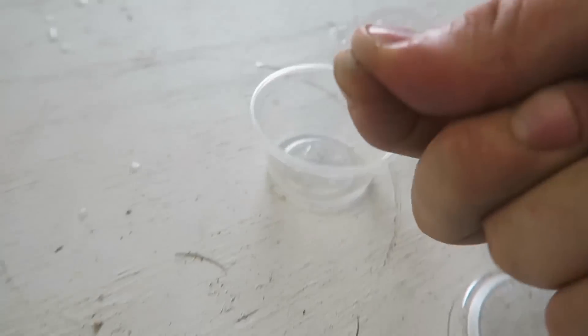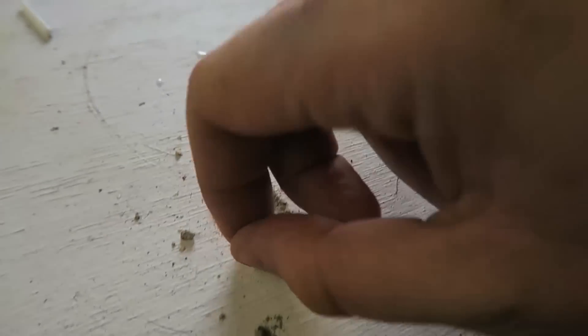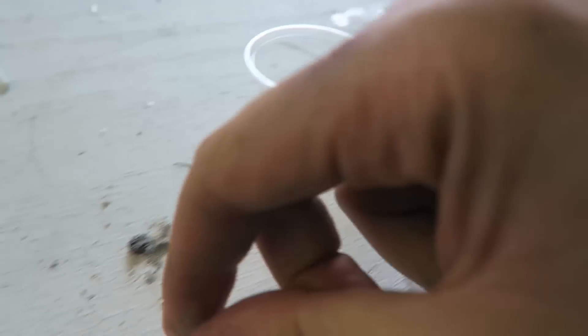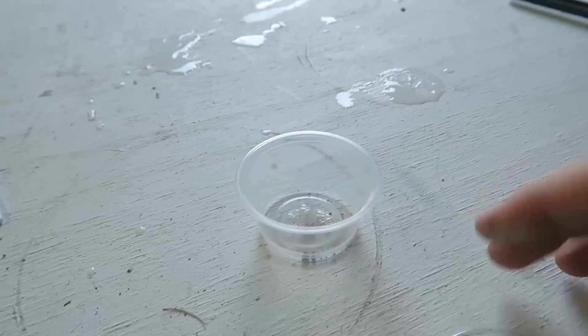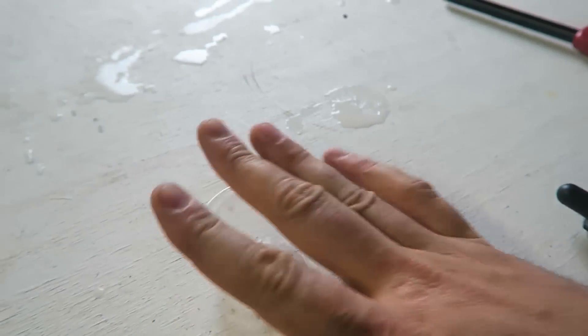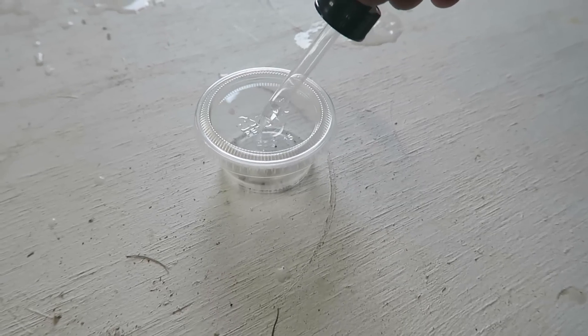So I made a mistake — I put too much carbide. You want just a little bit, almost like a sand grain. Very little bit of carbide. And again, I got a hole over here. Put it on now, and I'm going to put a little bit of water in there.